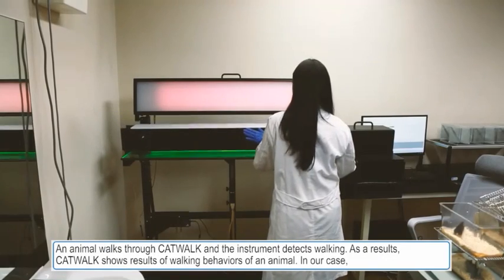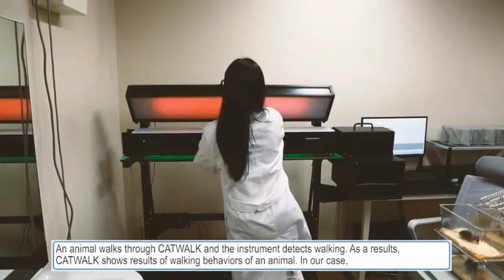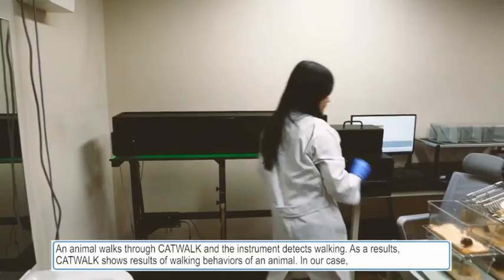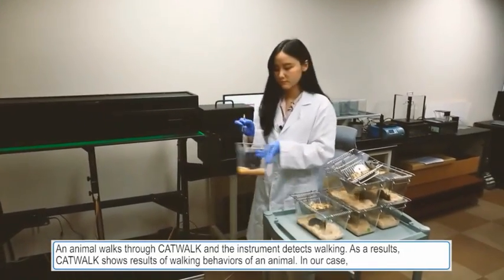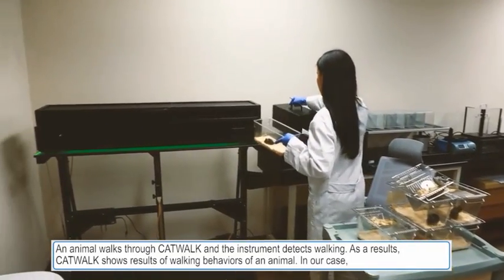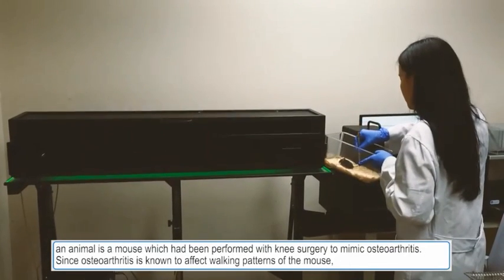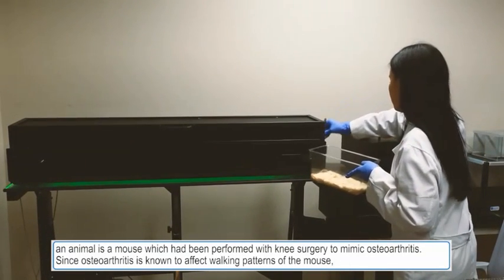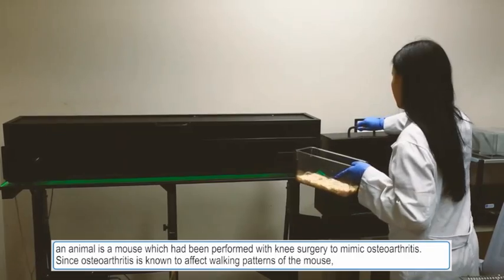Animals walk through CatWalk and the instrument detects their walking. As a result, CatWalk shows the walking behavior of an animal. In our case, the animal is a mouse which has been performed with knee surgery to mimic osteoarthritis.